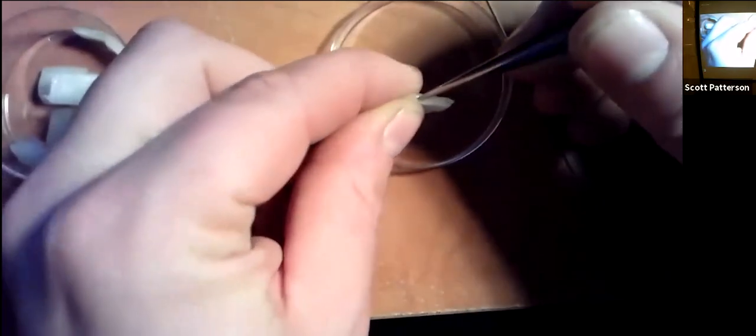You stab the side, see what I'm saying? And find an area and peel off, watch this. You see that? Peel off the skin, see what I'm saying? Here's the rest of the onion. Got more skin for later, so we put it back in the container. Then you put the skin on there.